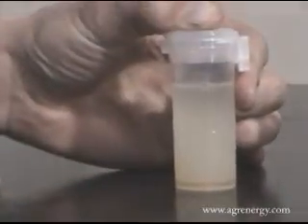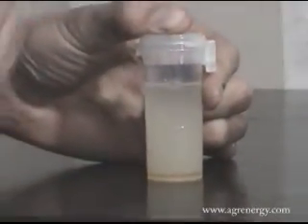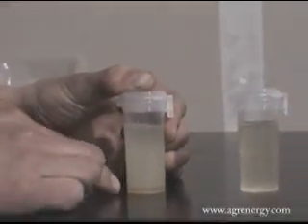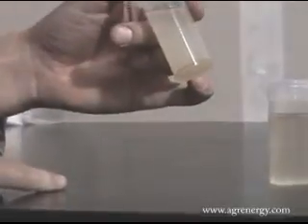The sample that was foggy, that had a high amount of triglycerides in it, is still foggy because it has these little particles of fuel floating around in there that haven't dissolved into the liquid. And we see this layer on the bottom, this second phase. Once again, that's fuel that was unable to dissolve that has started to settle out of the solution.